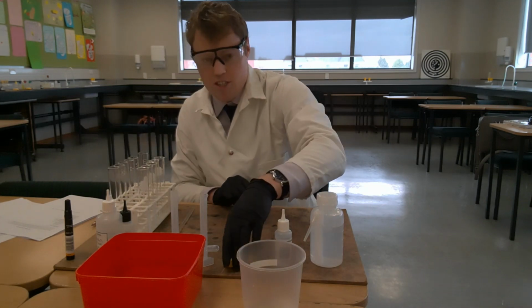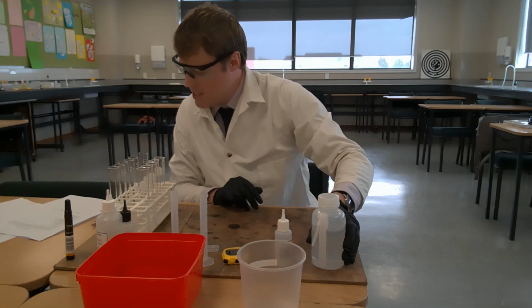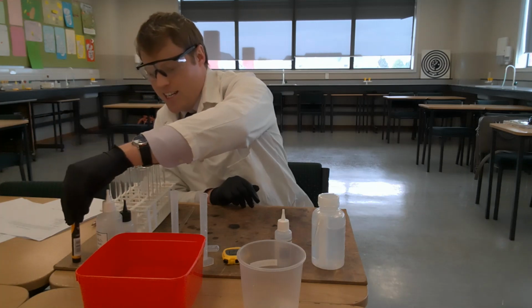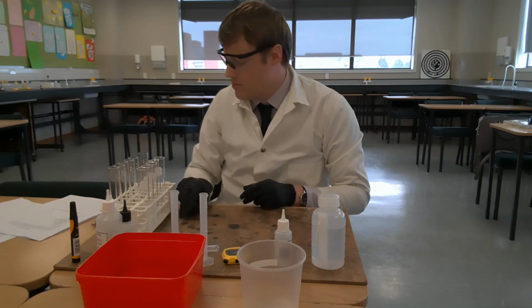And I've got a stopwatch, some distilled water, paper towels, marker pen, a stirring rod, and a waste container. So stirring rod there, waste container there.